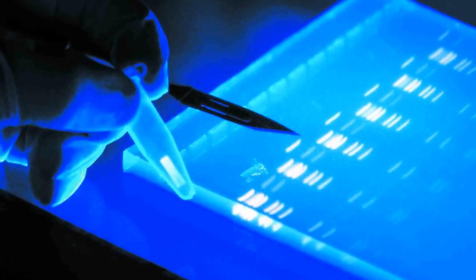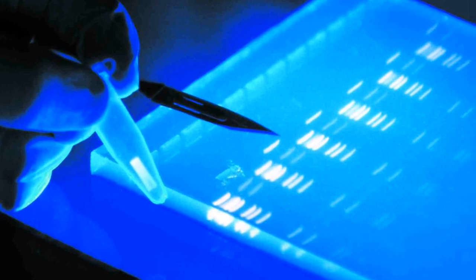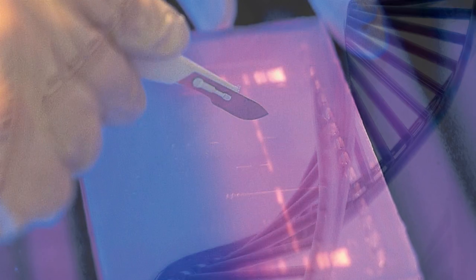Load it into the agarose gel of 0.8% concentration and observe the DNA in a transilluminator.